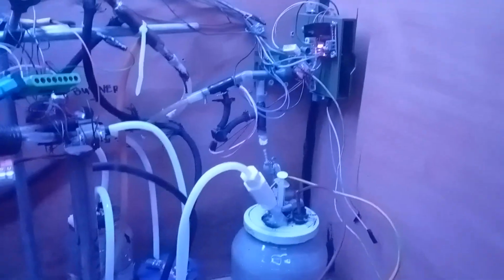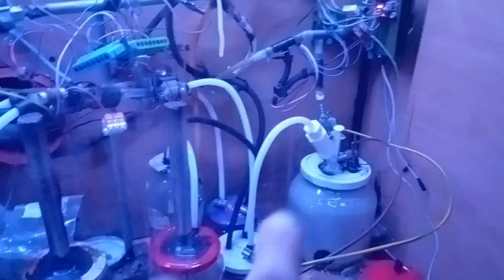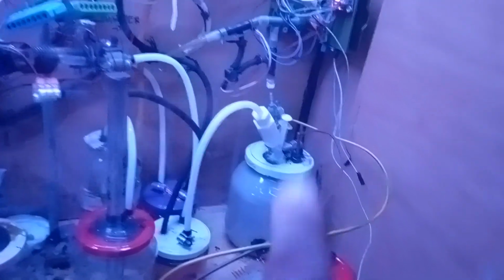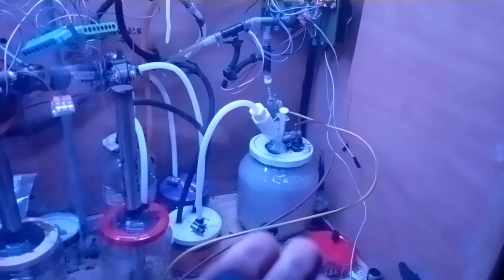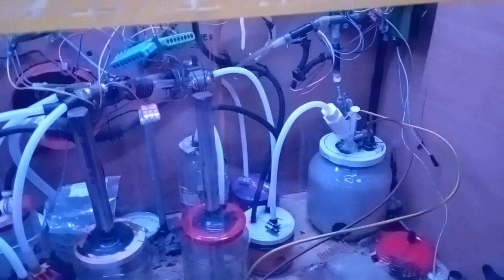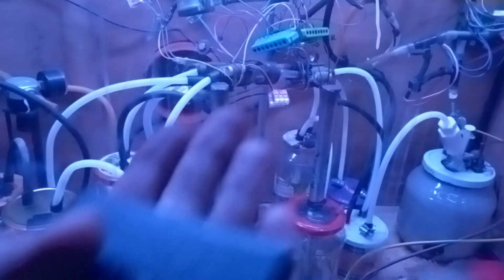Basically the problem now is that I have to make another needle valve, a manual one. I'm going to add it to the bypass side as well, and we'll throttle it a bit so that there is enough air going into that side, because the problem is that there is not enough sulfur there, or basically we don't burn the sulfur, we don't sustain the ignition. Thus we just produce some sulfur dioxide, push it through the system, it extinguishes, then the system returns to a non-working state.